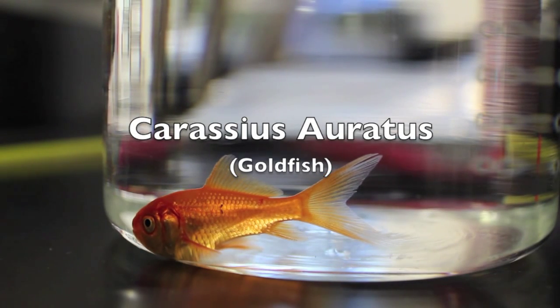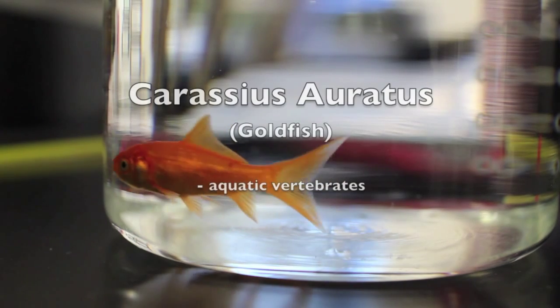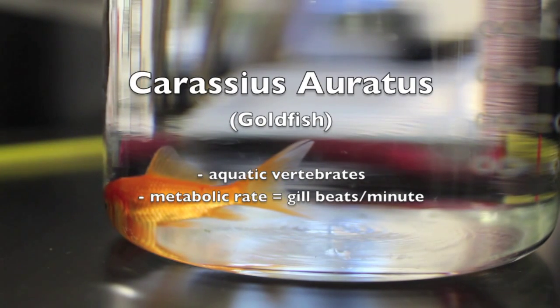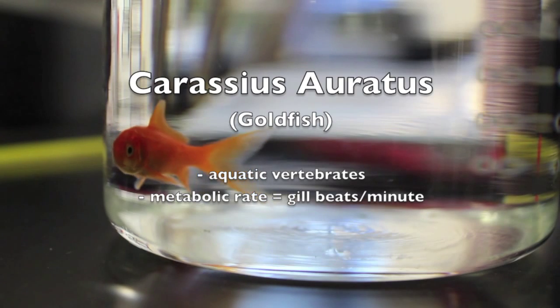Carassius auratus, also known as goldfish, is one of the most commonly kept aquarium fish. They're aquatic vertebrates whose metabolic rates are easily affected by environmental conditions. A goldfish's metabolic rate may be determined by counting the number of times its gill cover beats per minute.